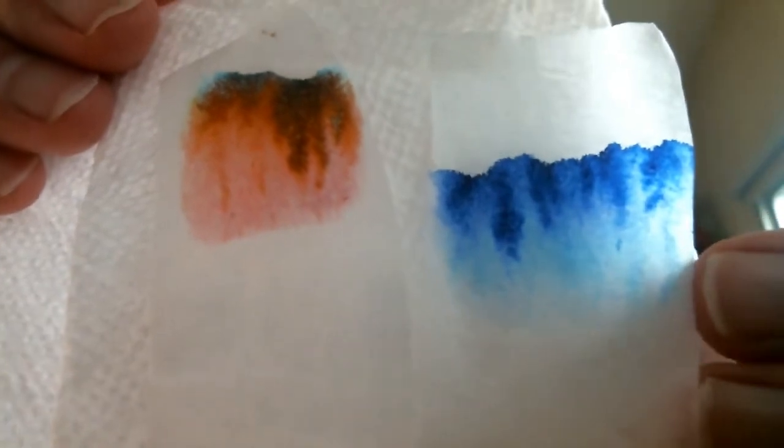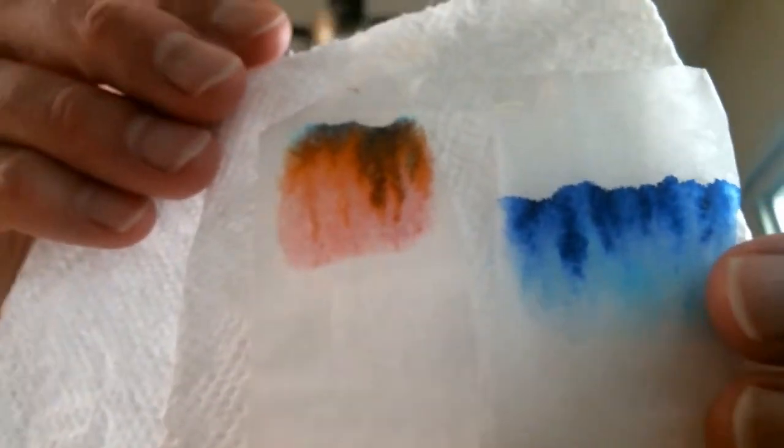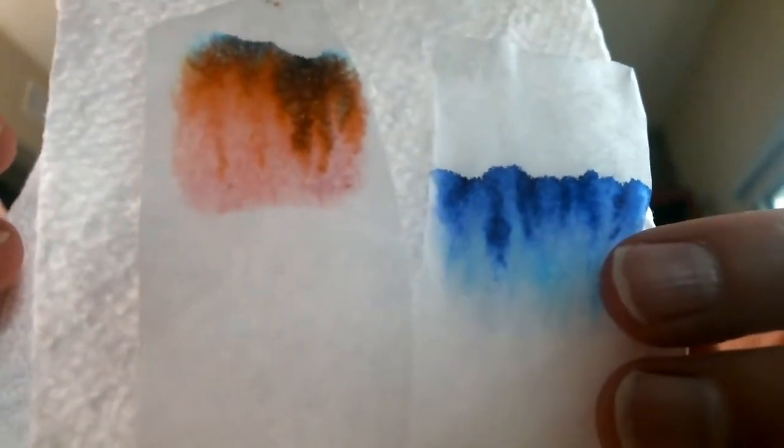Why does that happen? Okay, and here is the filter paper with blue, and it looks like there aren't different colors in the blue ink, and that's interesting to learn too. So this is a way of analyzing how different chemicals are formulated. All right, I want you to write in your lab why you think this phenomenon happens. Why is it that certain colors migrate a far distance and other chemicals, other colors do not?